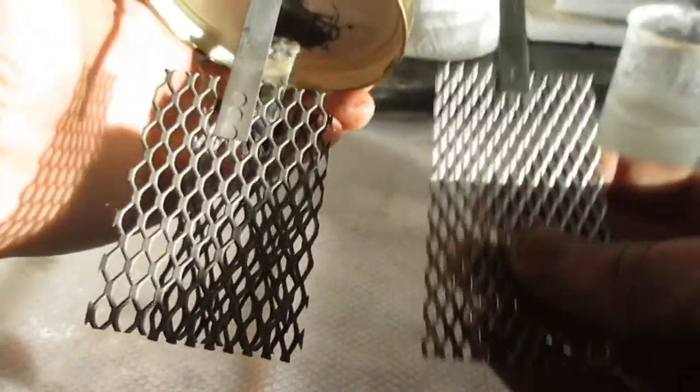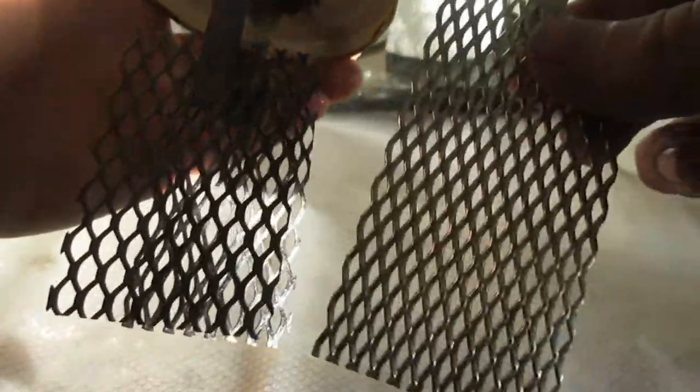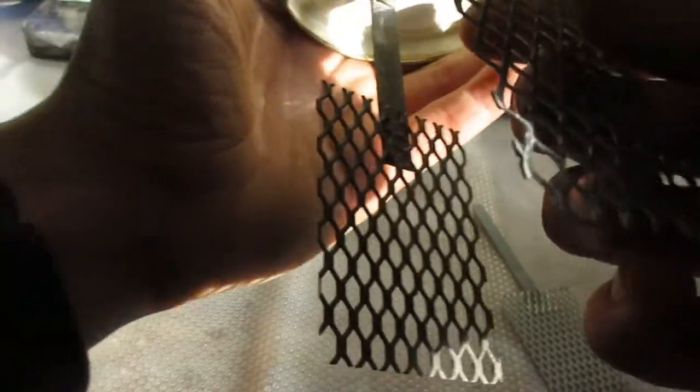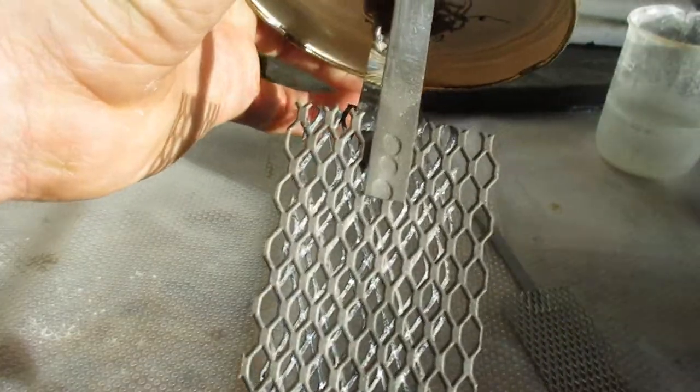Now most of these ones, these fake Chinese anodes, are really shiny. And the genuine platinum anodes I've recognized aren't really very shiny. You can see in the light here. They're kind of more a coarse gray texture, and yeah, not exactly as shiny as this.